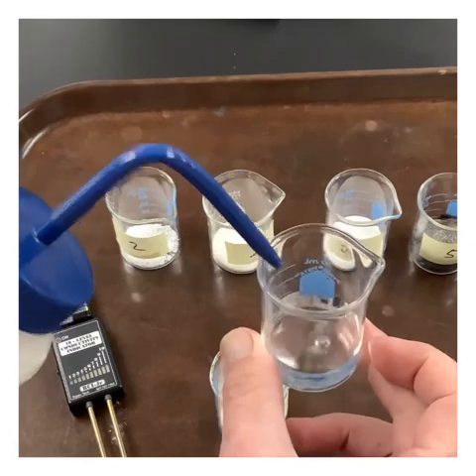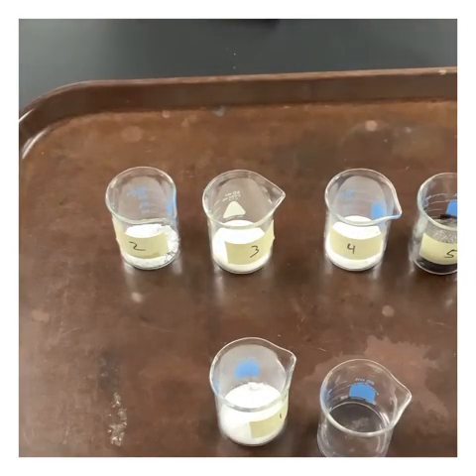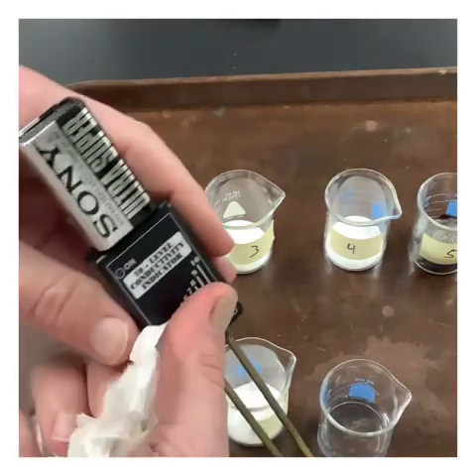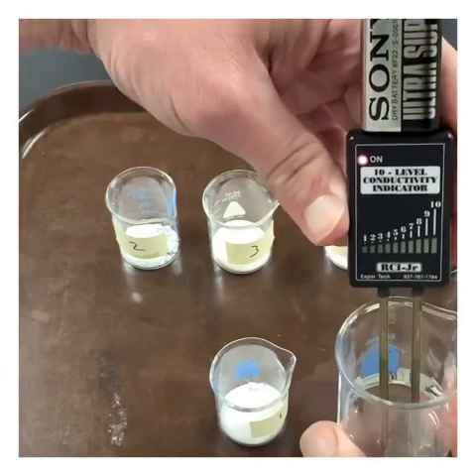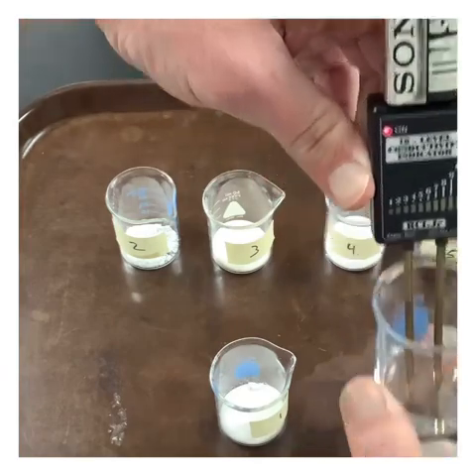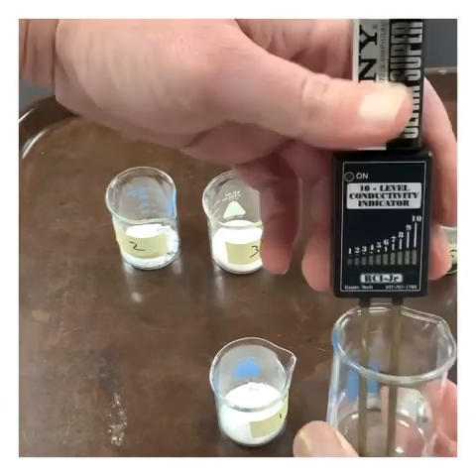We're going to go ahead and put a little bit in there. We're going to wipe off the ends of these leads since it was just in a substance, and we want to submerge it, and hopefully we don't get any conductivity. It looks like we've got it submerged nicely in there, and we're not getting any lights coming on. So this is good distilled water.